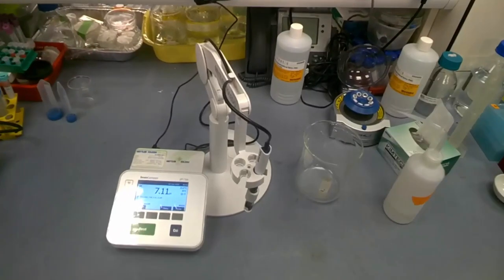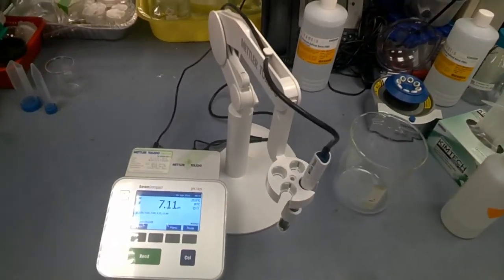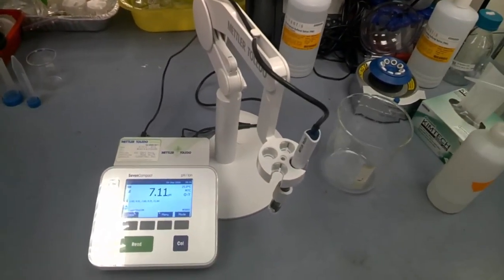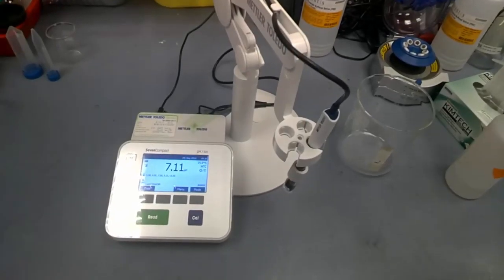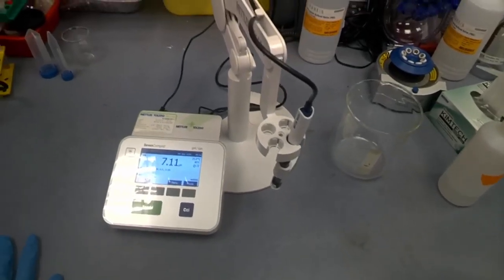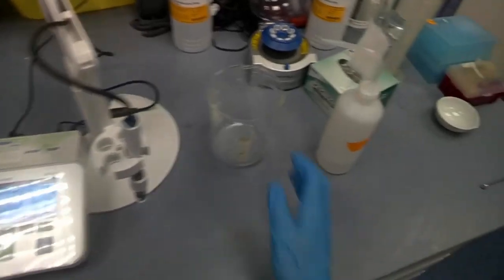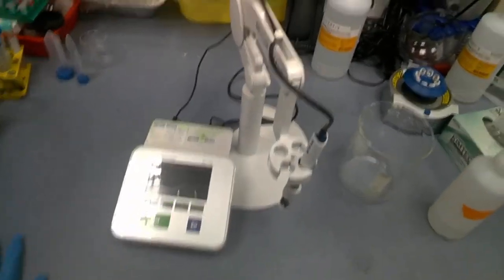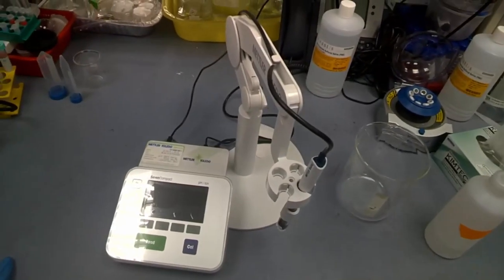Good morning guys. So here in this video, I'm going to demonstrate to you how we do a calibration of our Mettler Toledo pH meter. This is where the instrumentation is, and we need to have a beaker, deionized water, and to do calibration of pH meter, we need some pH buffer.